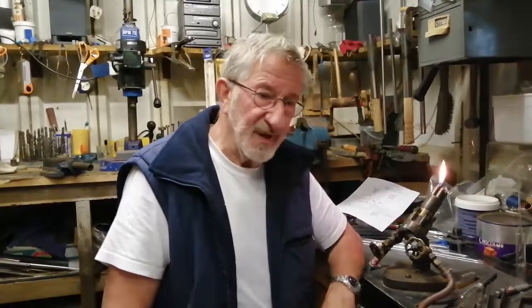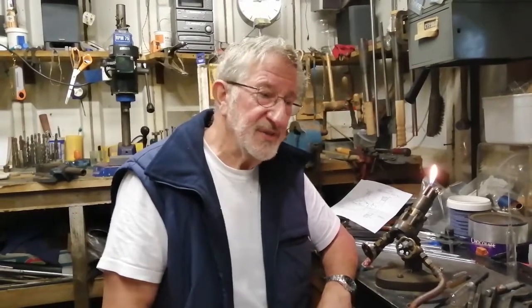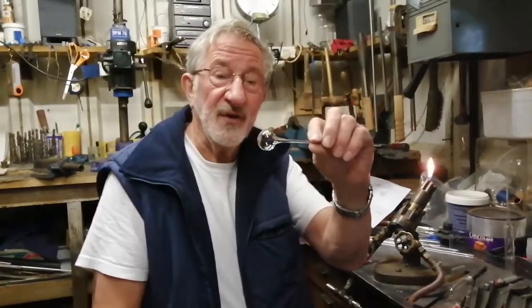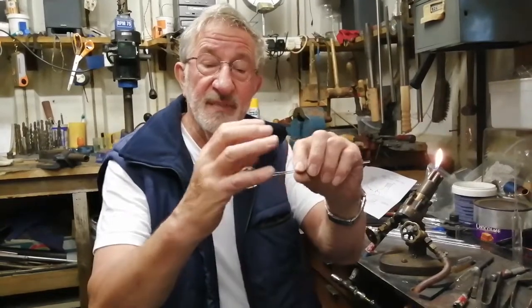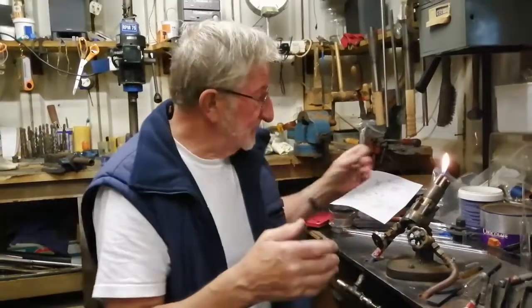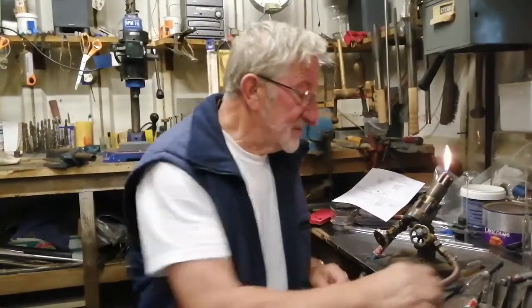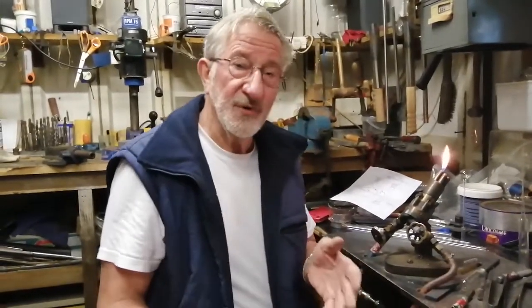Okay, now it's very important, and I always do a safety check before we start letting somebody sit at the glass blower's table or chair. It's most important, always take very careful note of what the expert tells you. That's most vital, because whilst it is technically safe, there are so many little things that can occur that are dangerous. For example, if I was to hold this bulb now, which I've just blown, that would certainly burn me. Now I know it's hot, so you have to remember something like which bit's hot and where did you put it down. And otherwise, the important thing is knowing how to avoid cutting yourself.